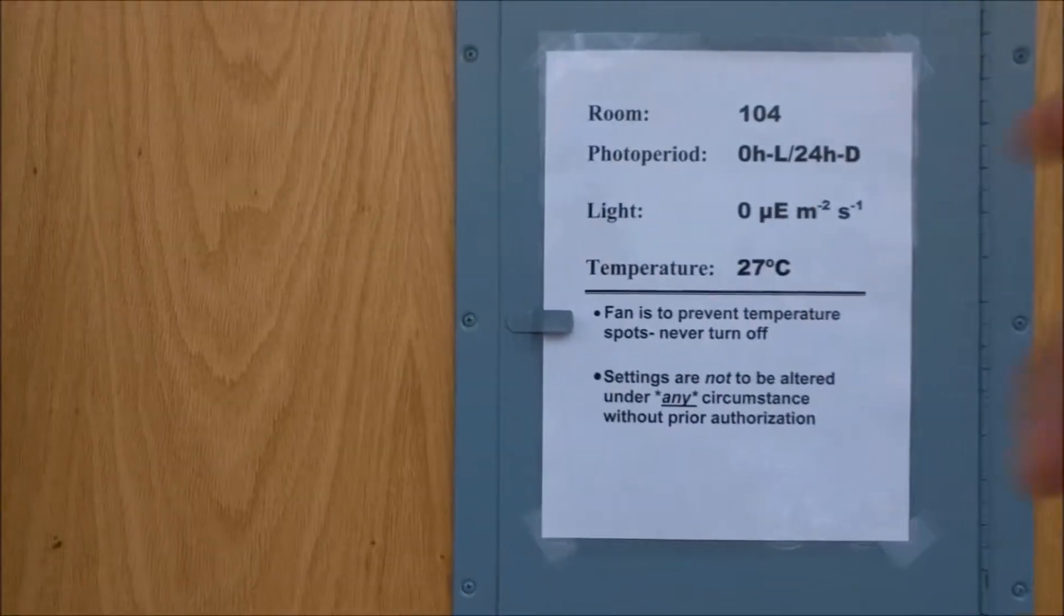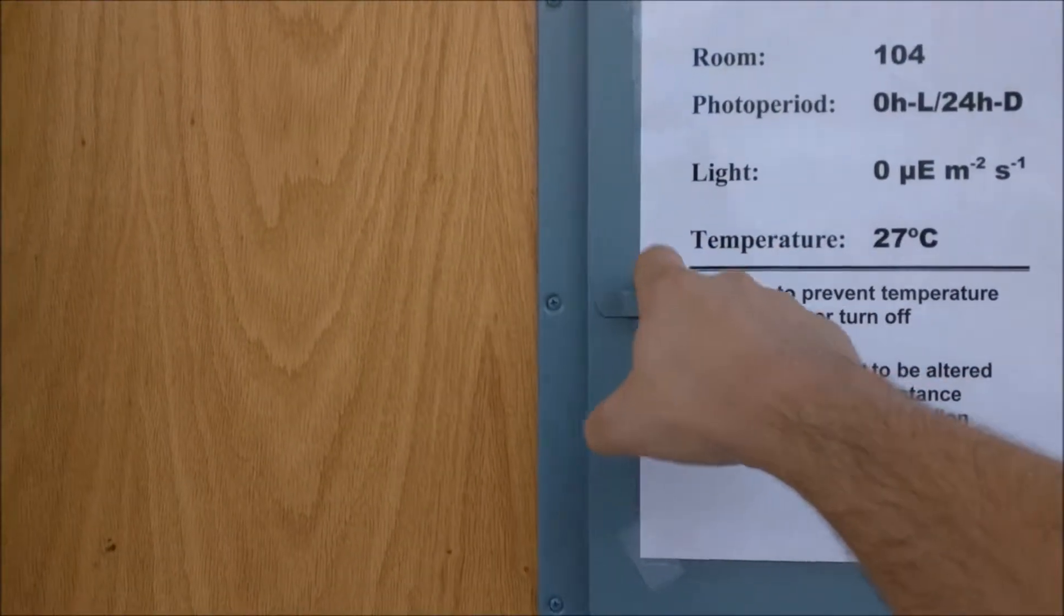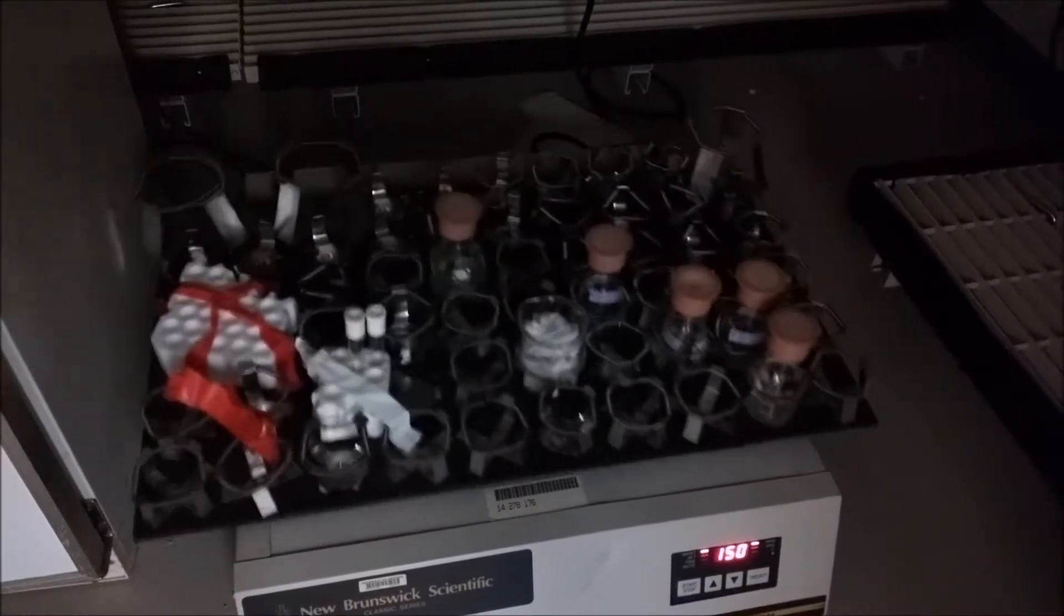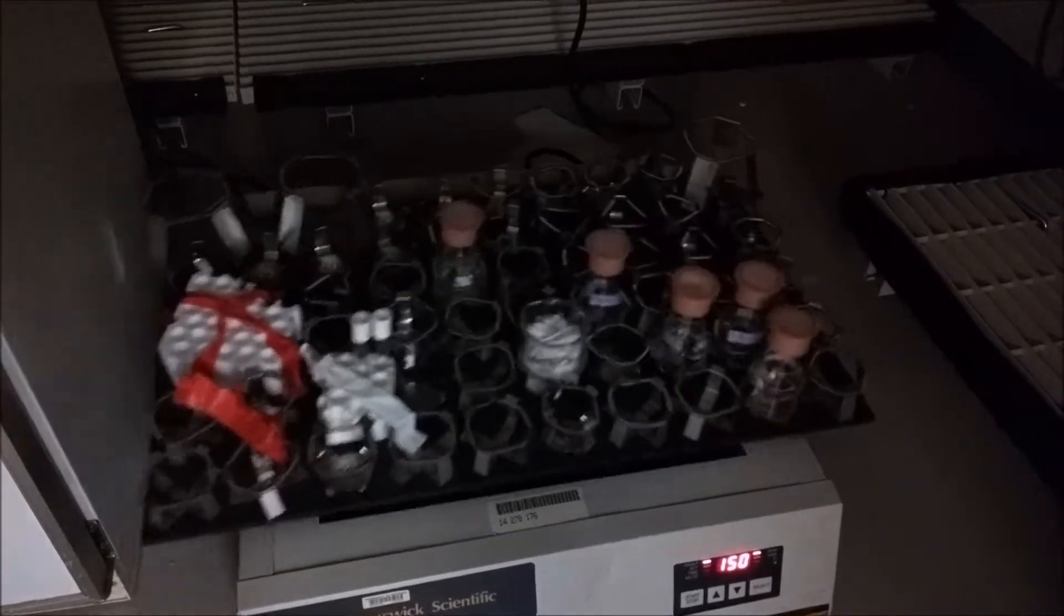Agro is a soil-dwelling microbe and thrives in this warmed dark room. We shake the cultures to increase air flow and discourage settling. That's happy Agro!